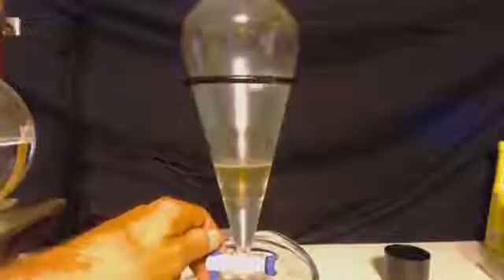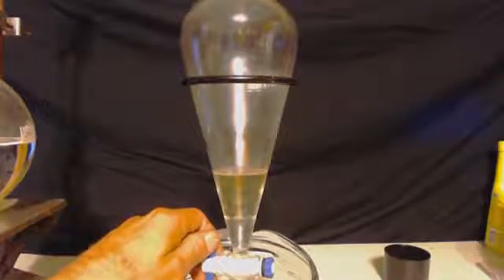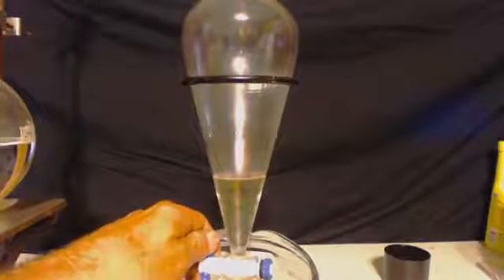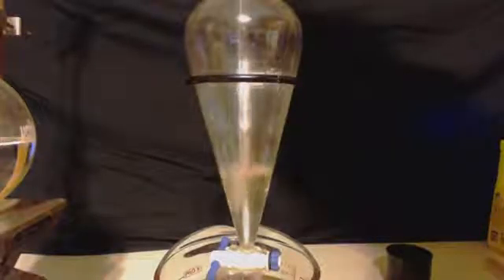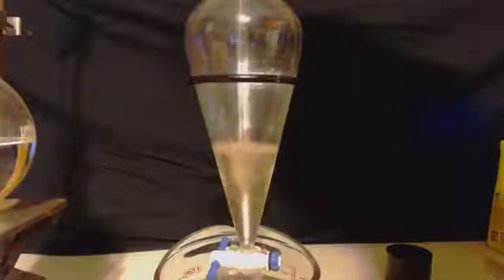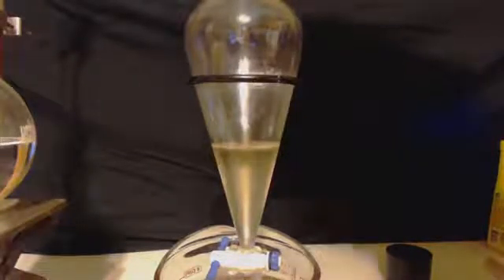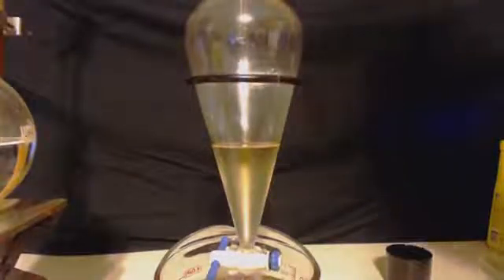Look again, I only put a little bit of water in there, but look how much that bottom layer is. It's pretty big for just putting a little bit of water in. So now, I drained that out, and as you can see, I only have half the can here. So, I'm going to go get the other half that I did, and we'll put both the halves together, and then that will be all of the hydrocarbons that came out, all the non-polar liquids that came out of that can right now in that separatory funnel.